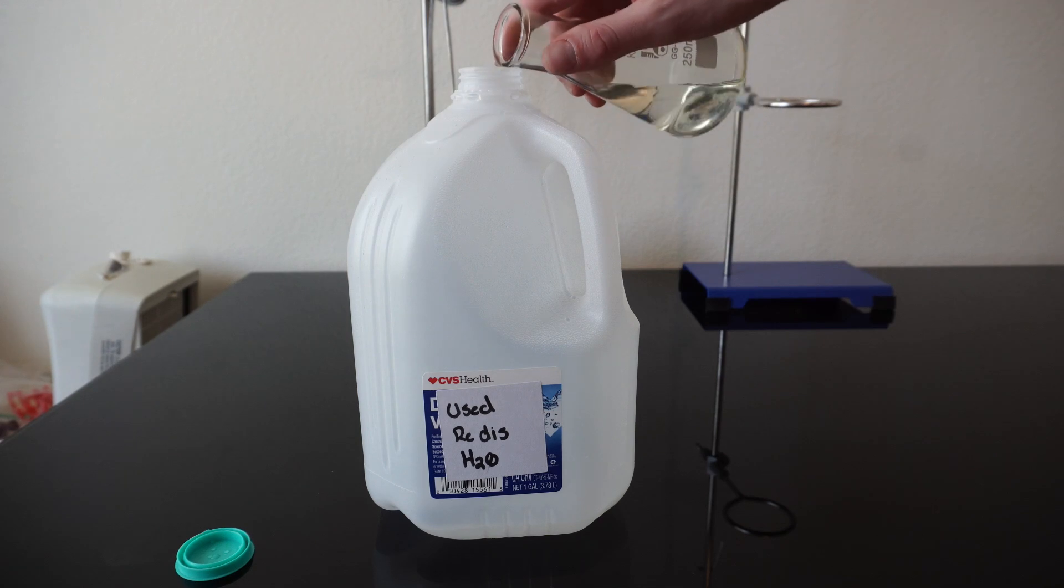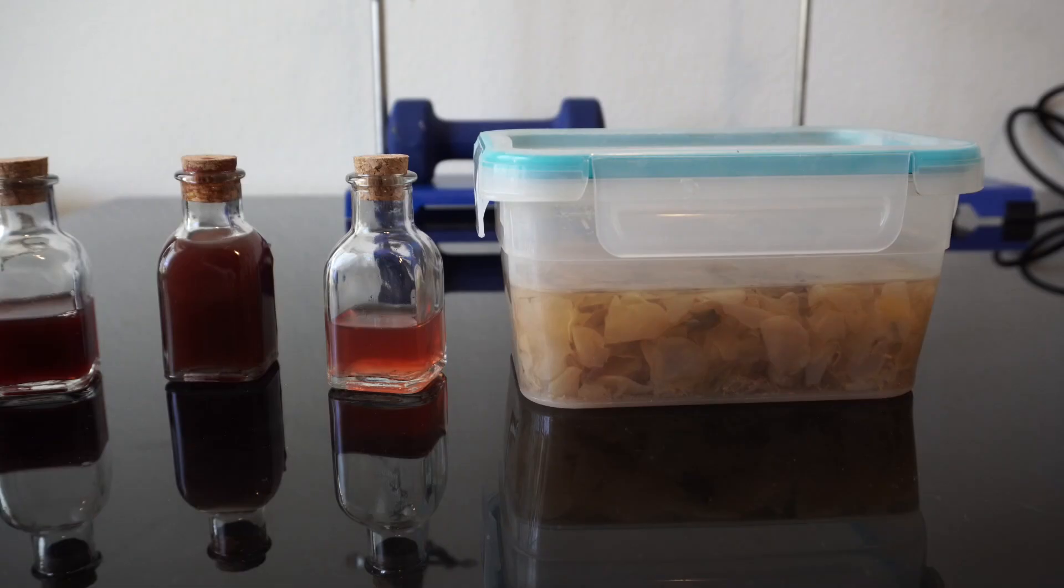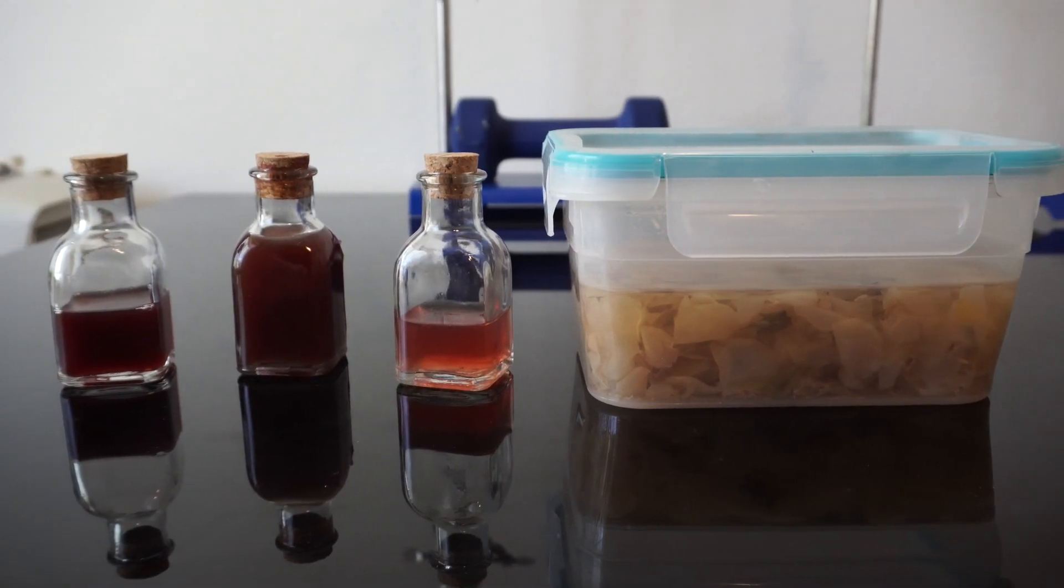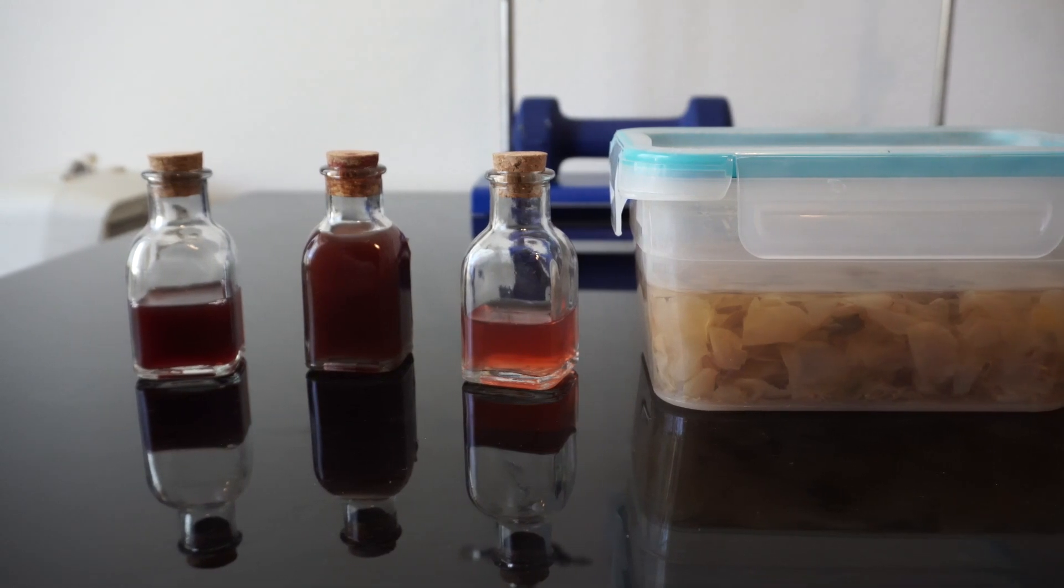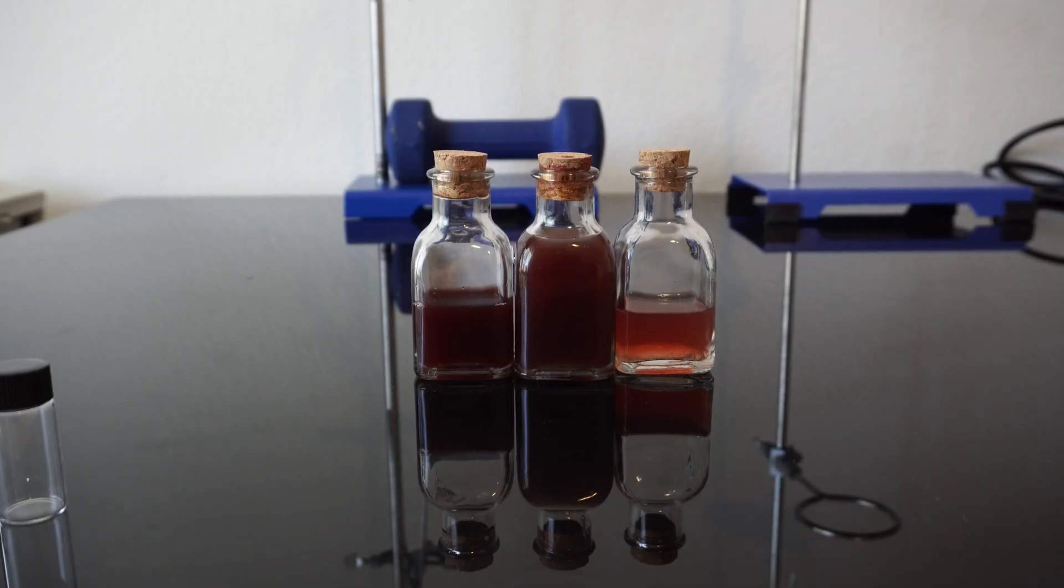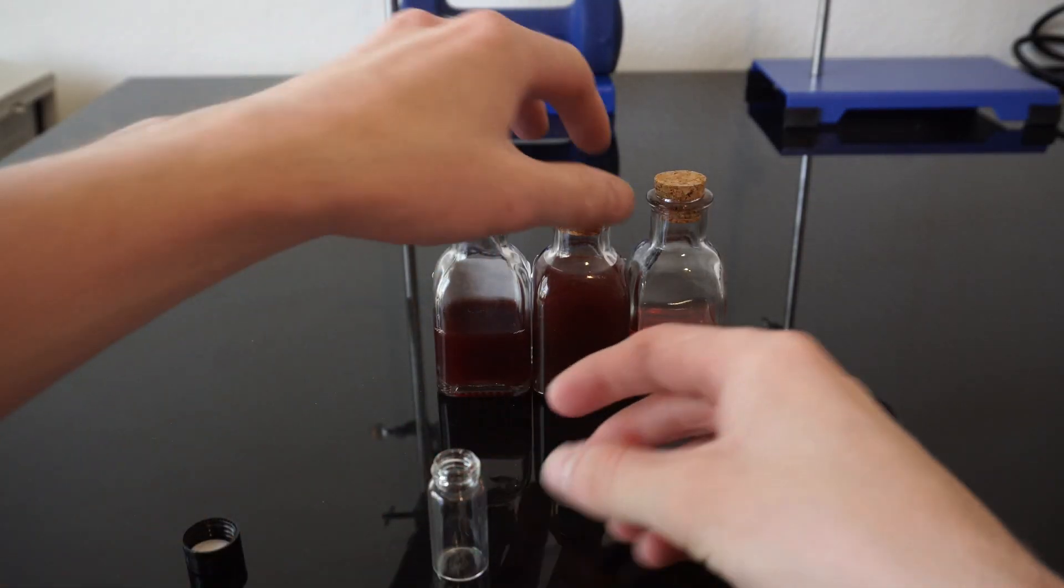And then the distilled rose water was poured back into my container for future use, most likely for a rose tea. We can see the few stages of what we did here. First we have the flowers on the right, followed by the distilled rose solution, then the redistilled second stage, and the redistilled third stage which we just saw.